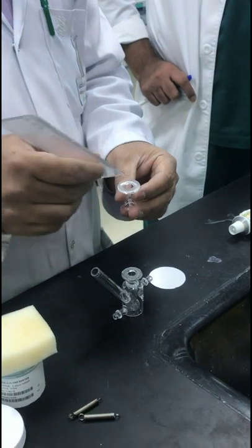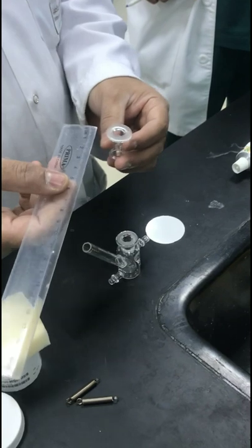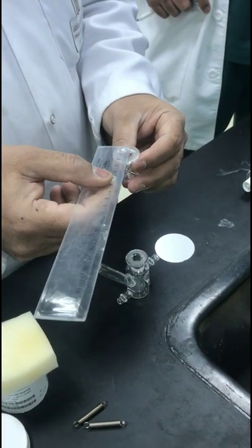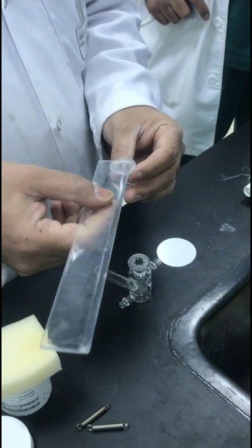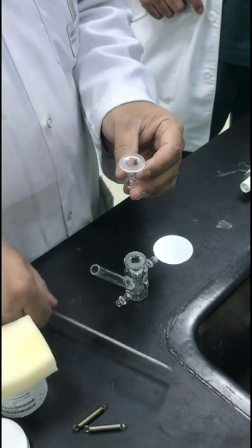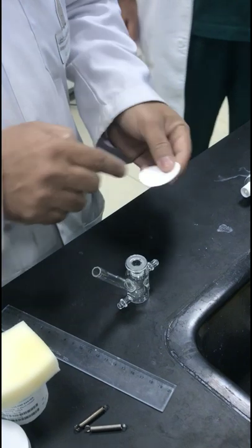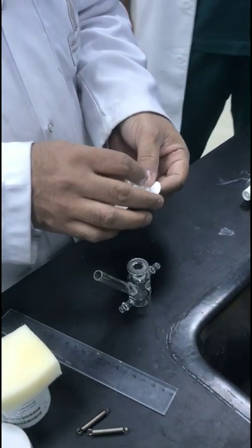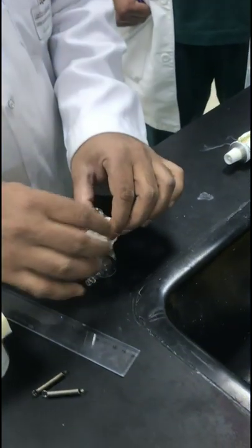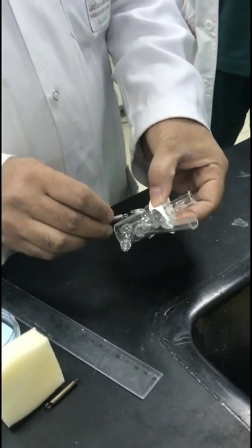The diameter of the opening is around 10 millimeters. You calculate the area using π r² — this gives you the area of the circle, which corresponds to the area of skin. You cut the membrane to the same size, place it here, and then tighten the assembly.